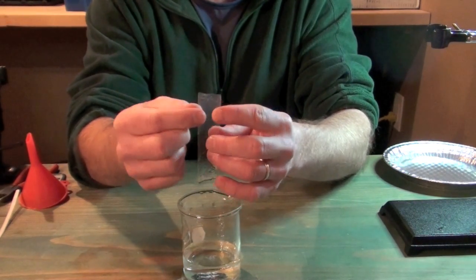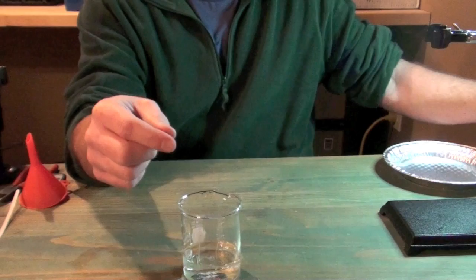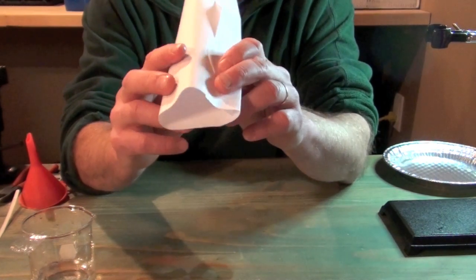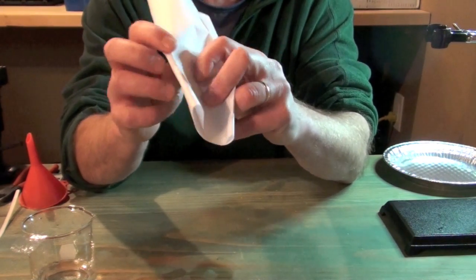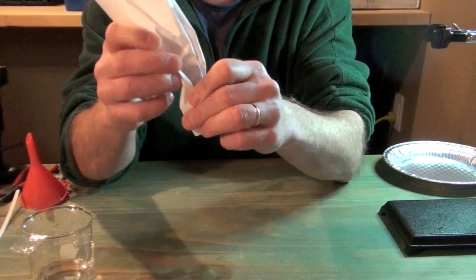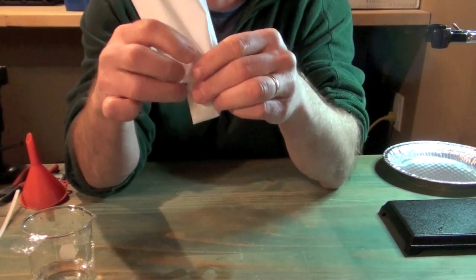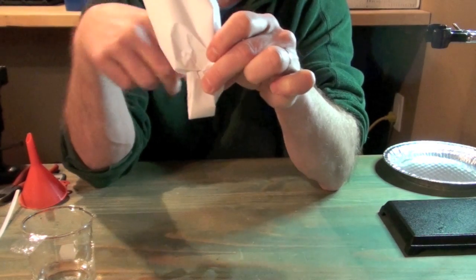So there is a slightly better way, and it starts with the proper preparation of the end of the bag. And just to show this a little better, if we imagine that this tube of paper is our dialysis tubing, what you want to do to prepare the end of the baggie for tying is flatten the end of the dialysis tubing and then fold it over. So then you fold it over once and then fold it over again, just like that. And then take that double folded end and fold it in on itself, just like that. Okay, so what you have is a double folded end, and then it's folded over on itself, just like that.